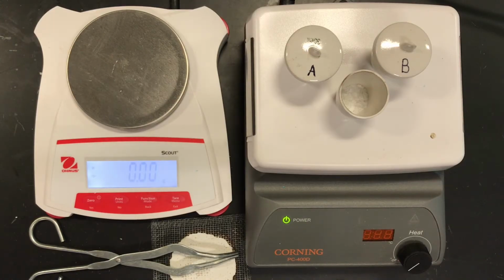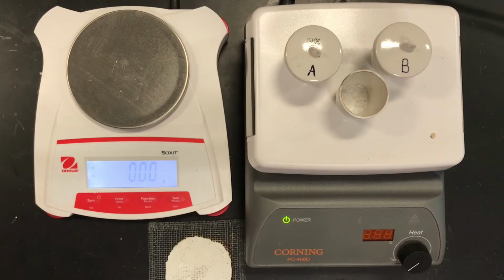So we're going to find the missing mass, find the grams of that missing mass, in this case the water, compare the grams of that water to the grams of the remaining solid, the anhydrate, and then using our mole ratios, determine the chemical formula, or in this case, the coefficient of water in the crystal. Remember, this is a compound. It has a definite proportion by mass. It has a chemical formula. The amount of water molecules in the crystal is constant, assuming our hydrate is perfectly hydrated and that we have a 100% pure sample. Okay, so with that, let's start our procedure.